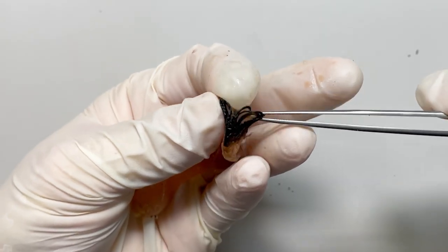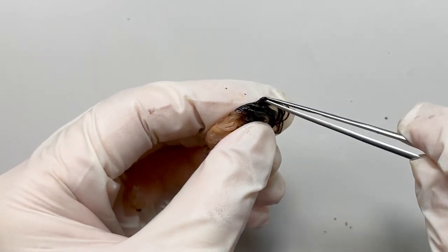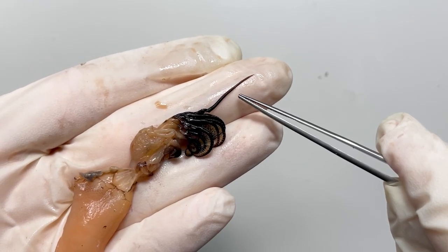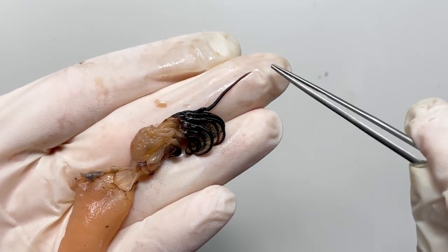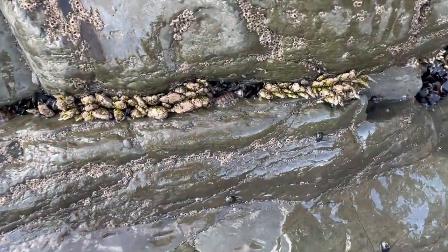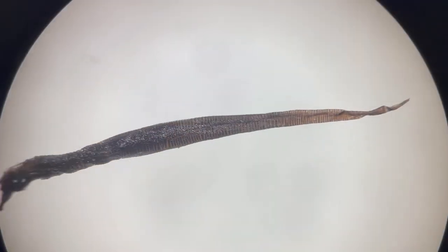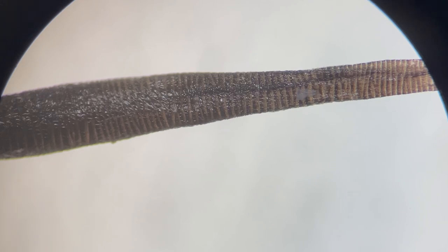The most amazing part of their body is located between the six thoracic legs. If you pull this carefully, you can take out this long organ. This thing is, surprisingly, the gooseneck barnacle's genitals. They are creatures that have huge genitals relative to their bodies. The reason they have long genitals is to extend them to mate with nearby individuals. If you take the genitals off and zoom in, you can see the wrinkled structure. Because of this, their genitals are very stretchy.